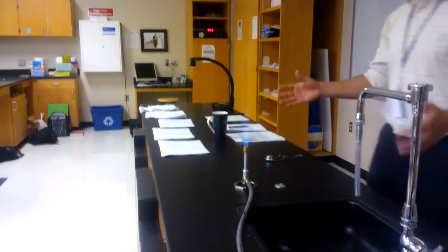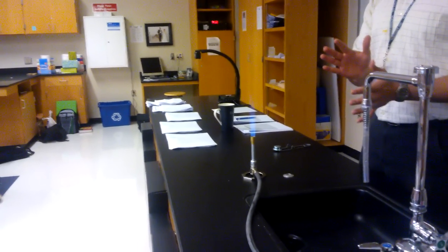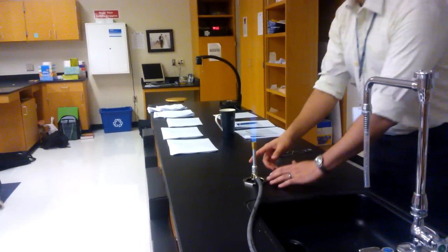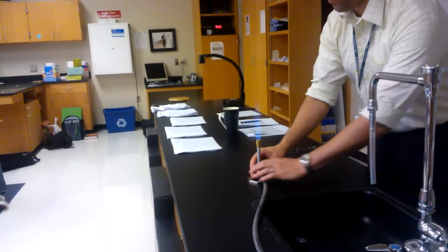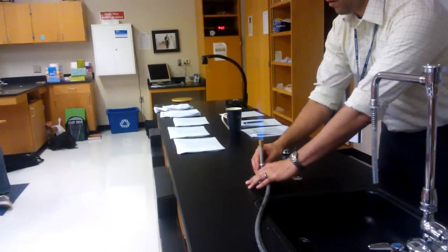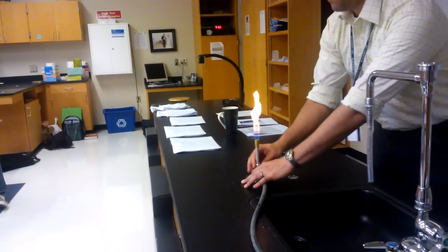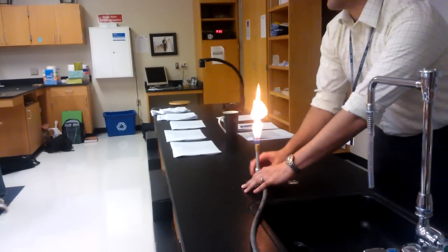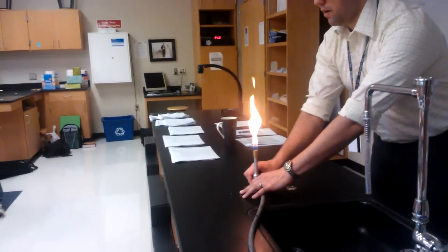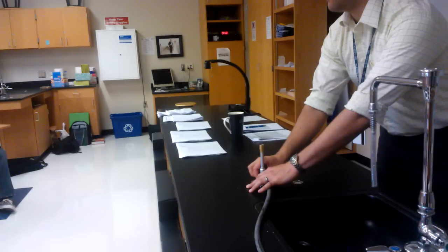So now I did all my work. How do I turn it off? I'm going to do exactly the opposite of what I did to light it. I'm going to start off by making it a yellow flame, a cool flame. Again, I put my hand on the bottom to hold the base so it doesn't tip over and close the flow of oxygen. Make it a yellow flame. Then I'm going to close the knob down here to extinguish the flame so there's no more gas coming out.